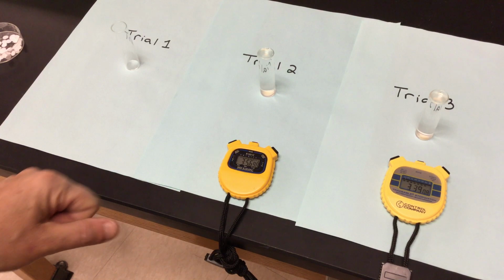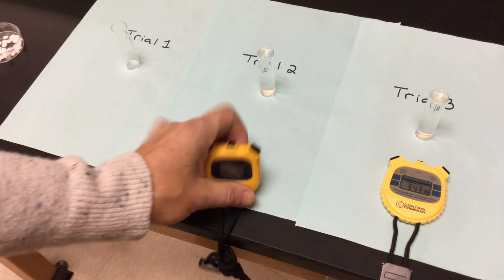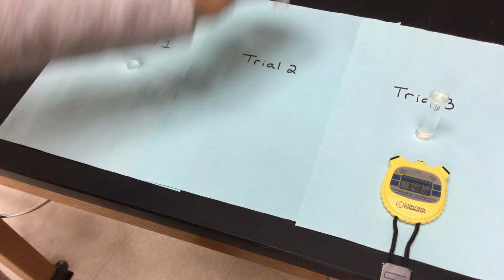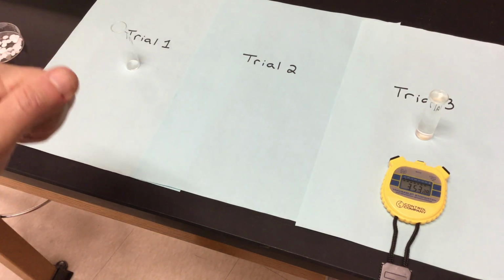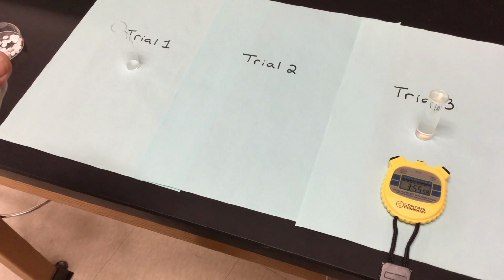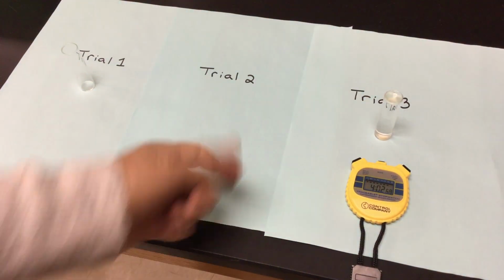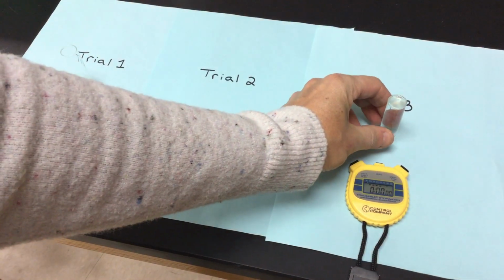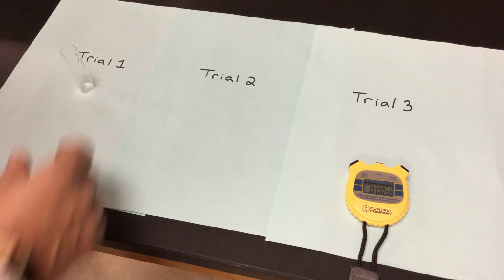We're almost at 4 minutes for the other two. We're at 4 minutes, so trial 2 for pH of 3 is also 4 minutes. And a few more seconds to go here just to make sure we have no movement on that filter paper. It's still sitting at the bottom. We're at 4 minutes. So I'm going to stop it. So what you have for a pH of 3 all the way through trials 1, 2, and 3, we are at 4 minutes for all of them. So I'm resetting my timers.